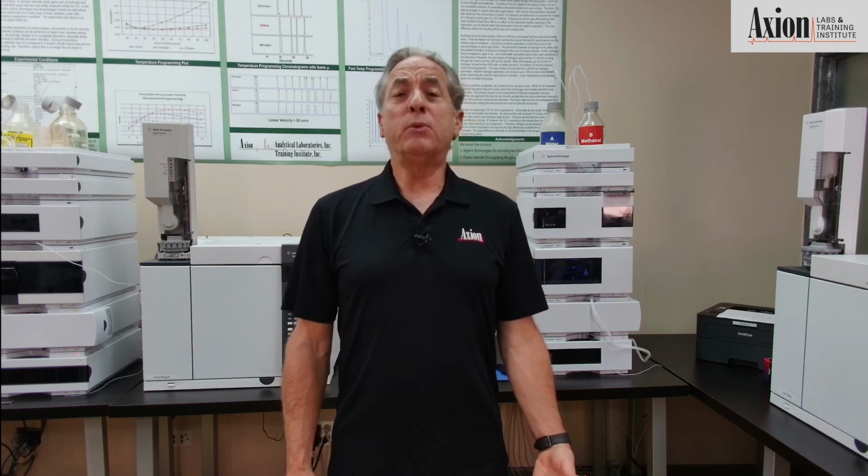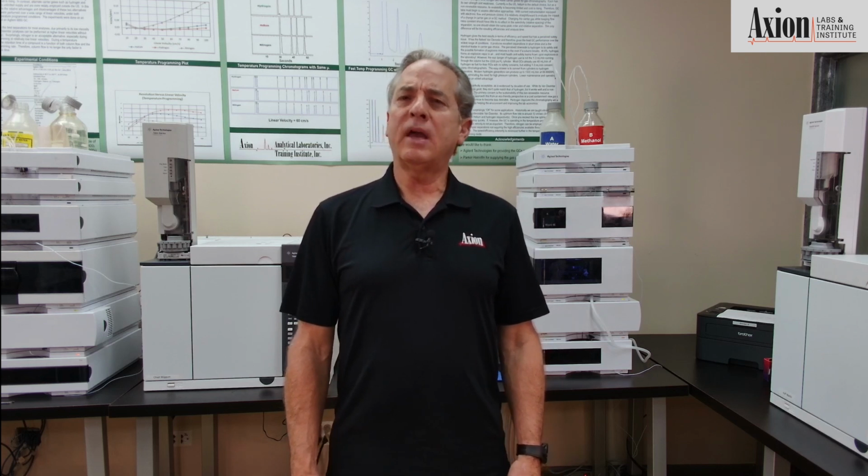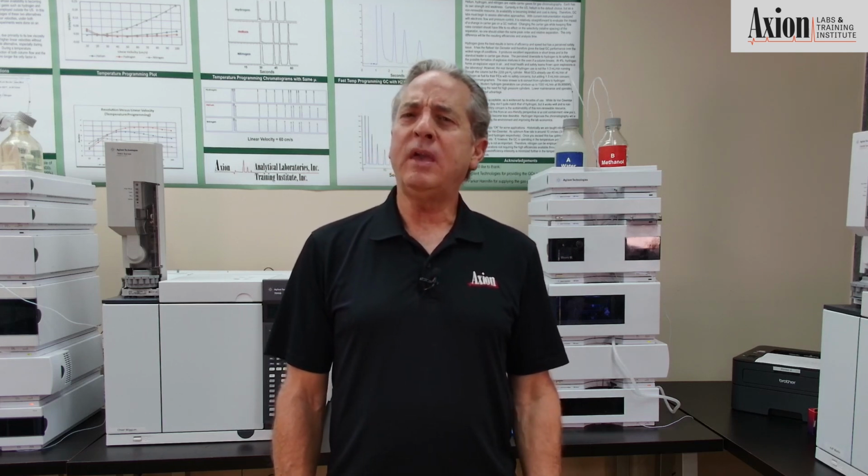So in the refractive index world, it's not uncommon to get a negative peak with the refractive index detector. If you're getting that on a UV detector, that's a problem. That's a separate issue that we need to talk about. In UV, you get a negative peak at the T0. That's fine. That's totally acceptable.